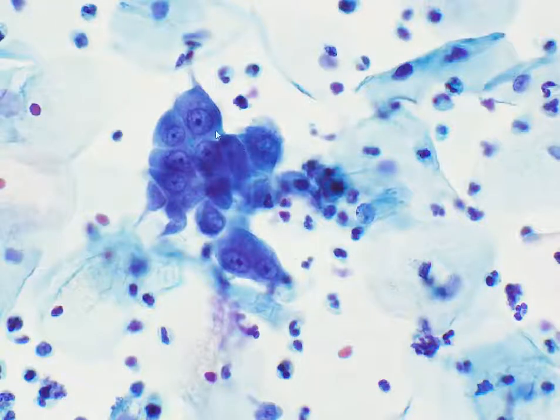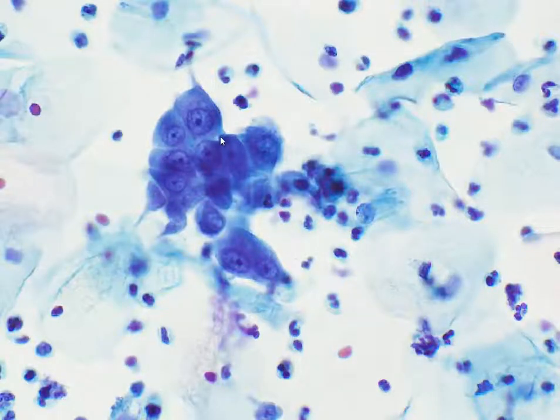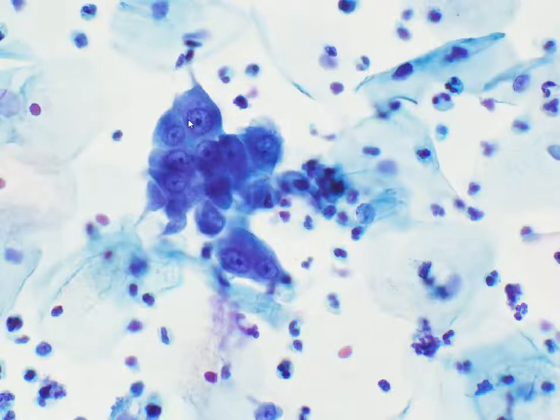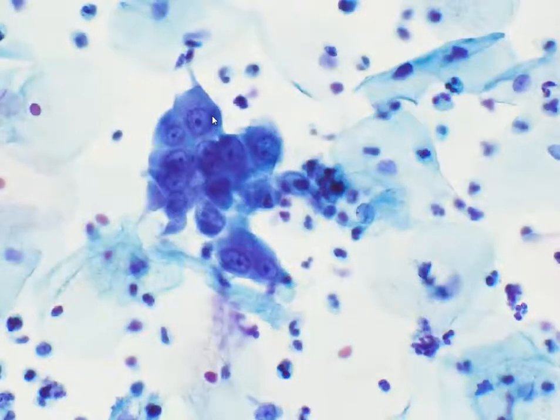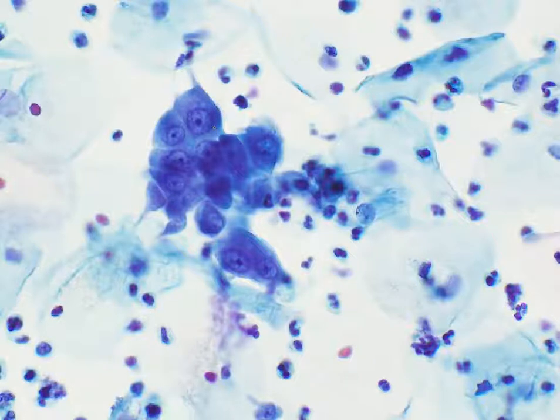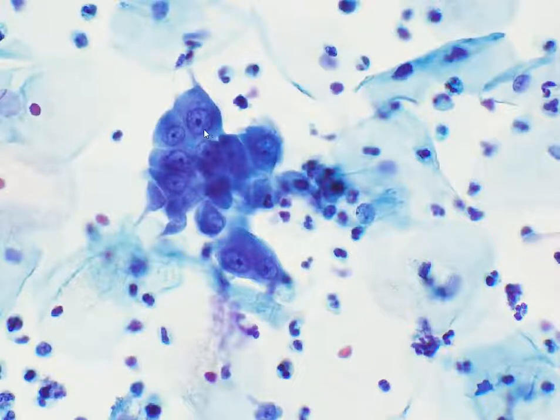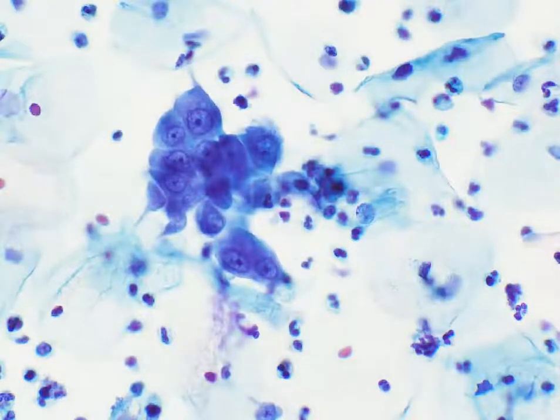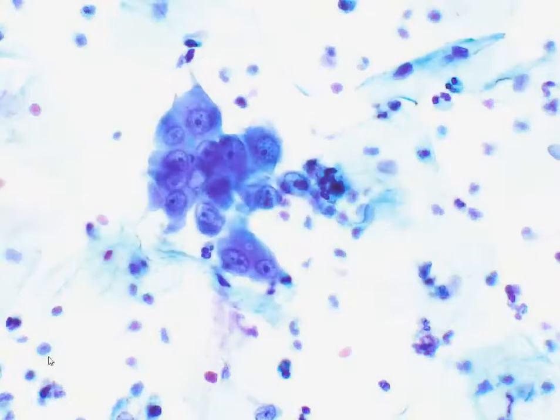At a different field, we can appreciate that the nuclei are large. The nuclear membranes are very smooth, the nuclei are extremely round, the chromatin is quite open, and there are prominent nucleoli.